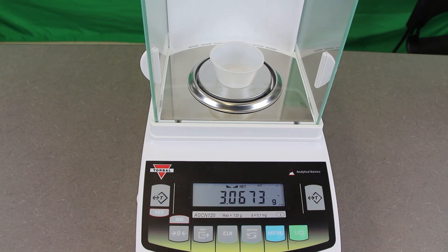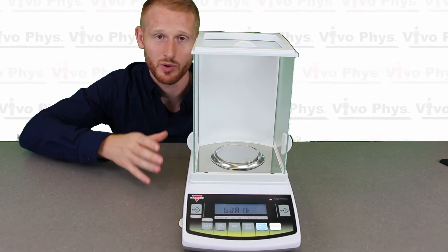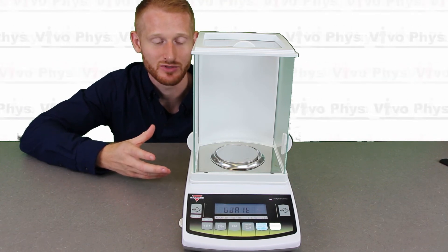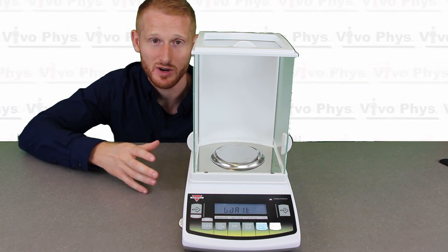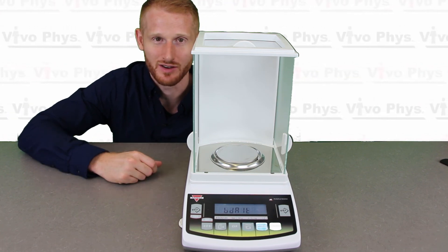If we need a little less or a little more than that, we can adjust how much salt is inside the cup to get the exact amount of whatever substance we're measuring. I hope that was helpful — that was a quick introduction on how to use a precision scale. They're used all the time in biochemistry labs for measuring out different substances used in science and research. If you have any questions, put them in the comments below and please come back and watch another video. Thanks.